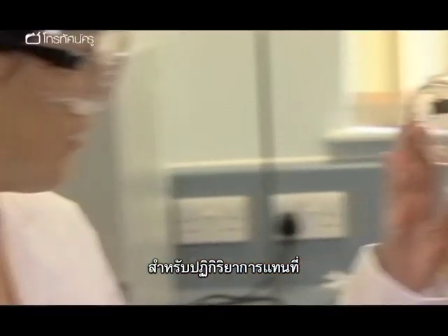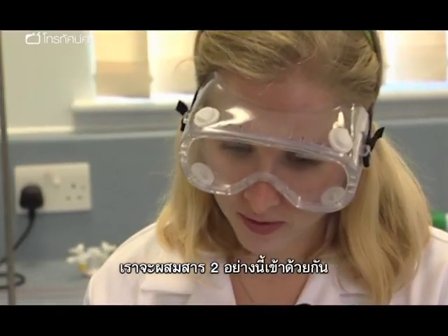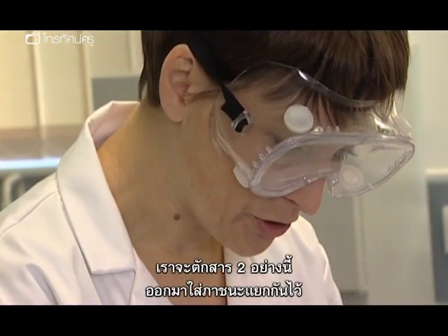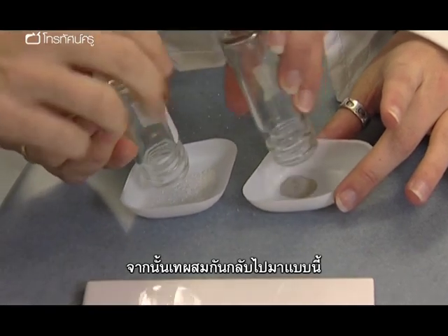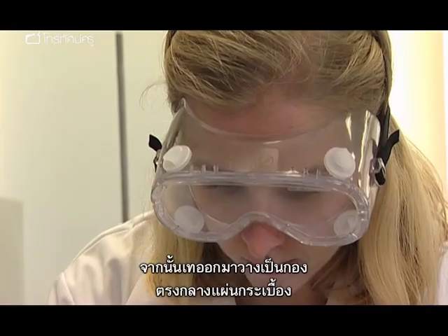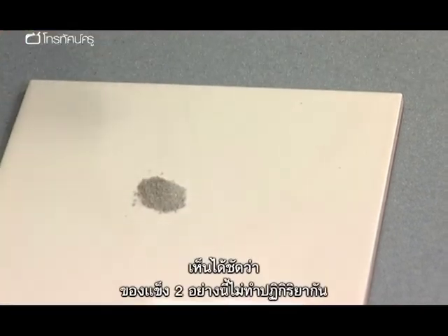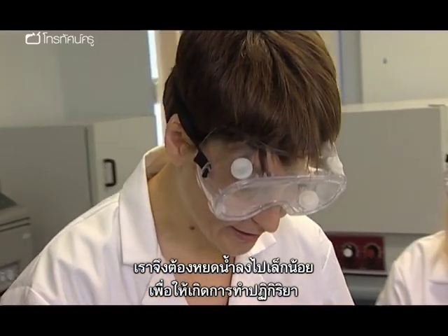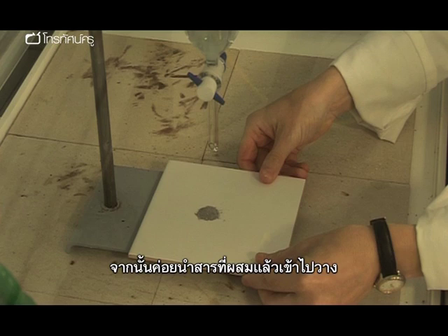This is an interesting variation on displacement reactions. We've got some magnesium powder and some silver nitrate crystals, and we can mix the two powders which we've kept completely separate — everything is completely bone dry. We tip the powders into their own little weighing boat and mix them by rolling them backwards and forwards. Gentle mixing to avoid friction is vital. Then tip them and make a nice little heap in the centre of the tile. Now, two solids aren't going to react together, so we need a little drop of water to get the reaction going. Set the tap to drip about once every five seconds and place the mixture just after a drop has fallen. Stand well back.